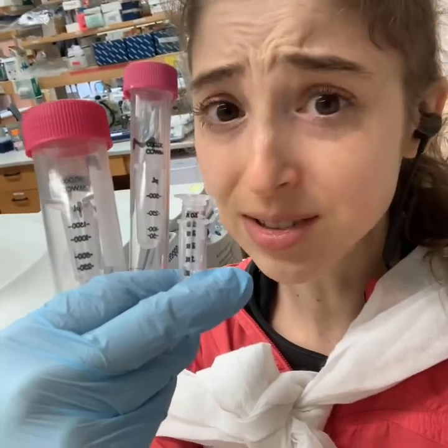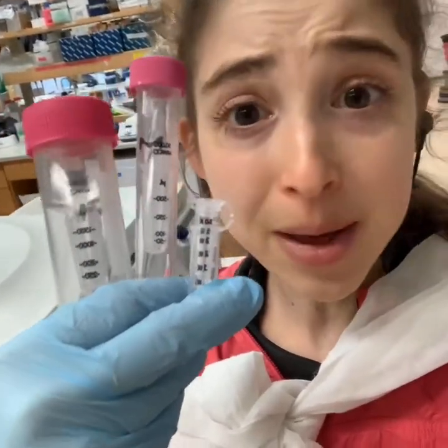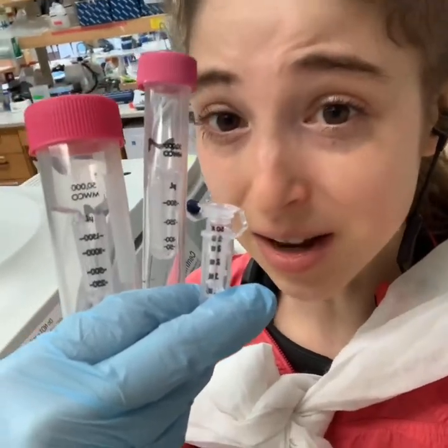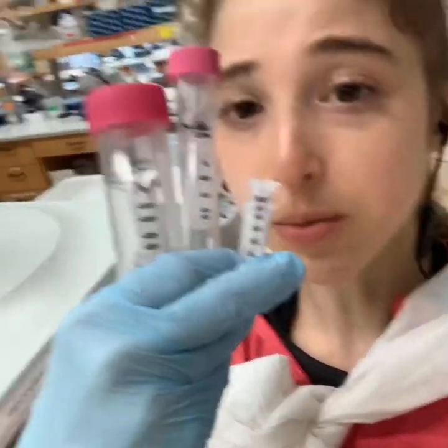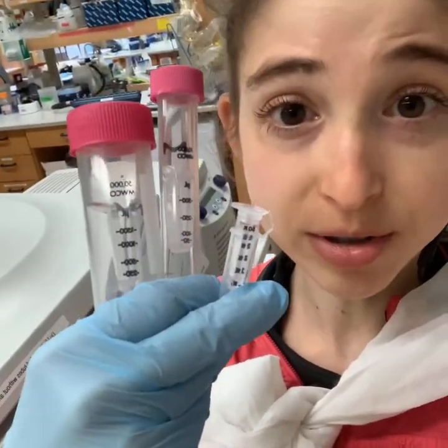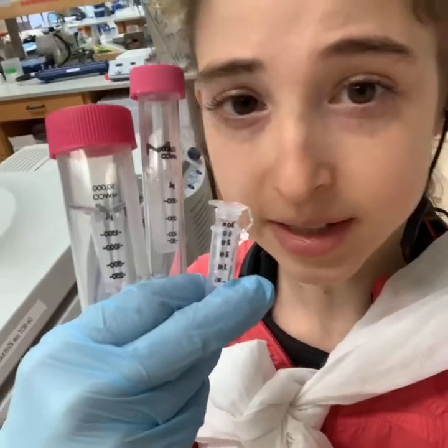I have a really hard time pronouncing 'centrifugal' — centrifugal? I don't know. But anyway, these things are little devices that we can use to concentrate protein solutions. I typically use them for proteins, but you can also use them for DNA or RNA.